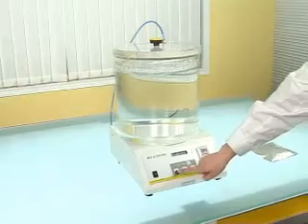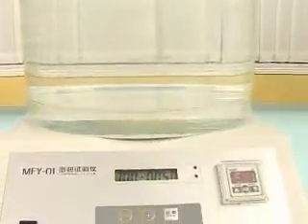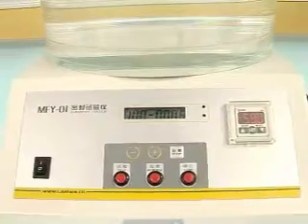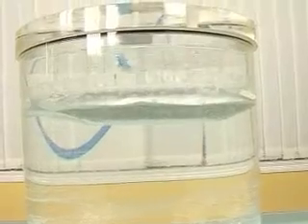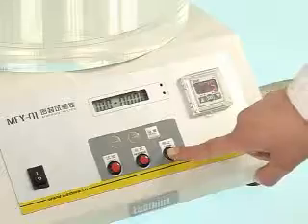Start test. Check if there are bubbles coming from the sample. Reach the preset time. Test ends.